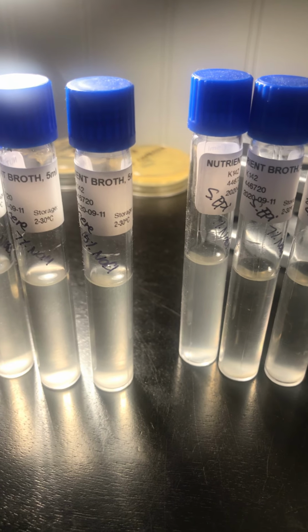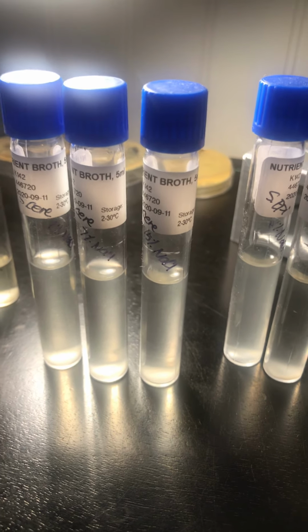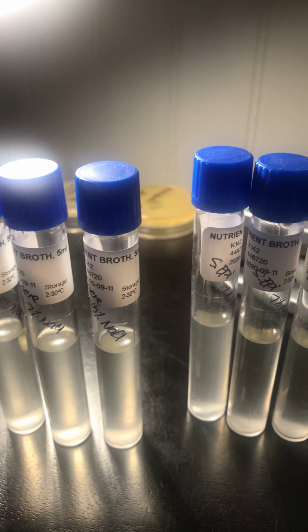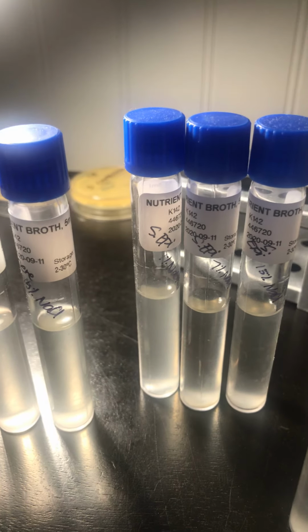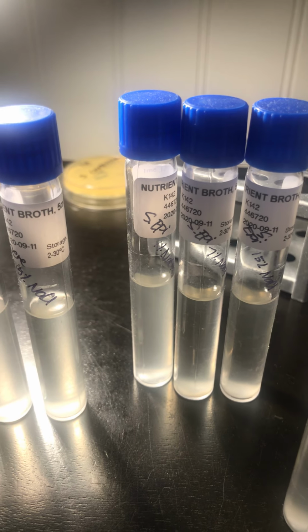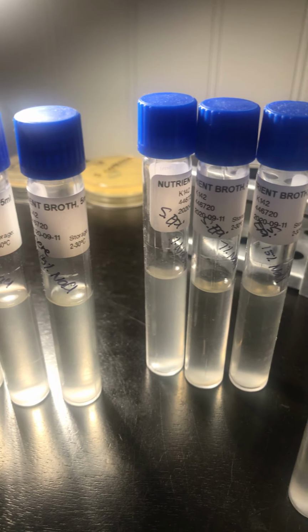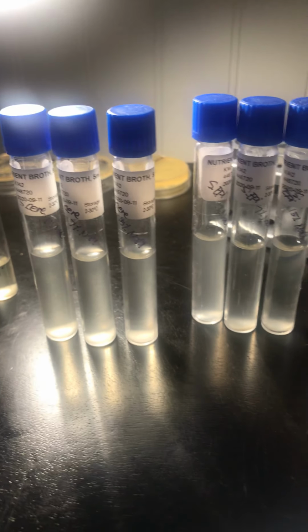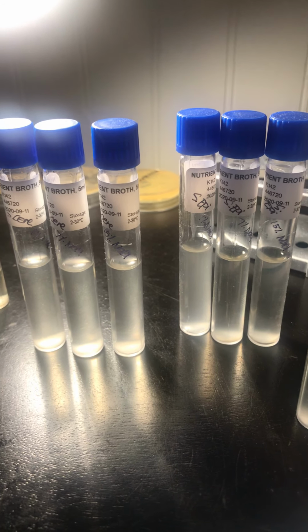Then you also want to put 2 drops of S. cerevisiae culture broth in each of the tubes, the 1%, the 7%, and the 15%. And the same thing for S. epidermidis: 2 drops of culture broth into the 1%, 7%, and 15%. Then we inoculate all 6 tubes in my designated area, which is the pantry in a box, and incubate for 24 hours.